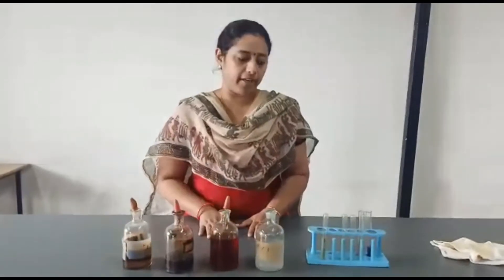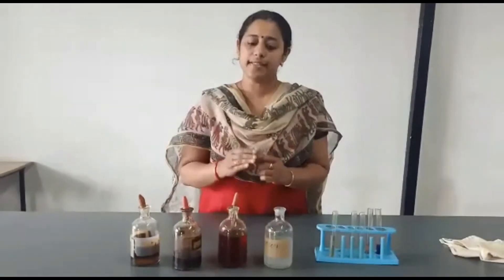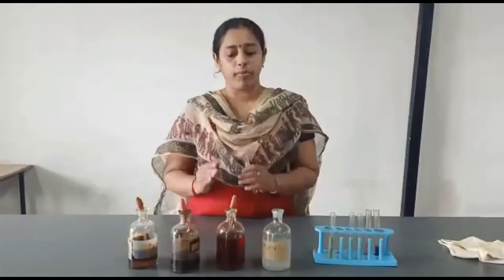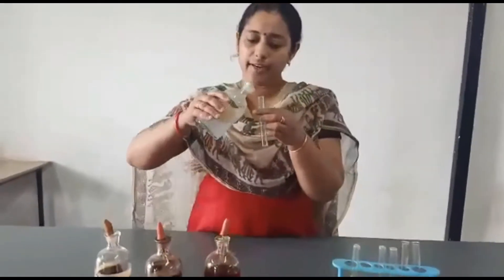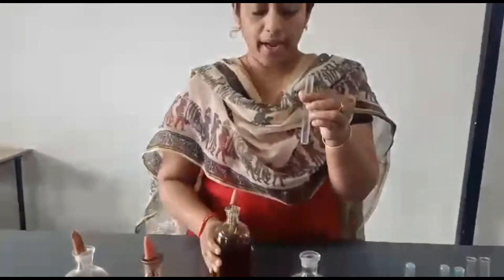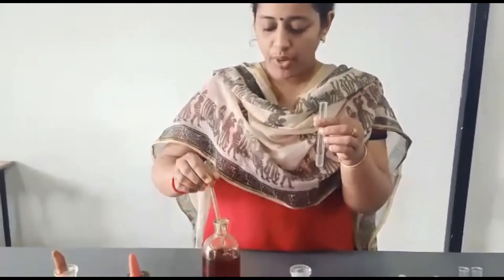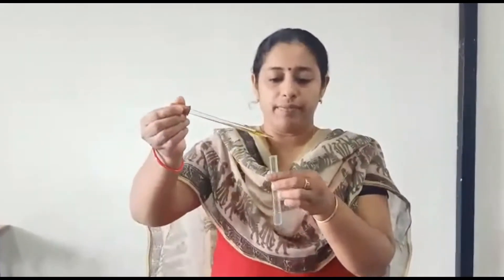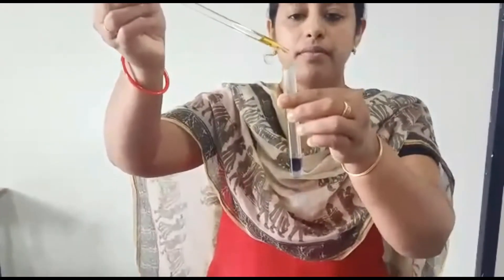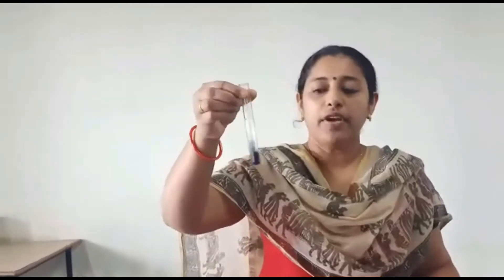Now I am going to start the practical. As I told you, we have to perform 2 tests. The first test is the Iodine Test. First you have to take the starch solution in a test tube — you have to take 3 ml of the starch solution. Now you have to add iodine with help of a dropper. With help of this dropper, we can put the solution drop by drop. So we have to add 2 drops of iodine solution. After adding iodine solution, you have to shake the test tube.